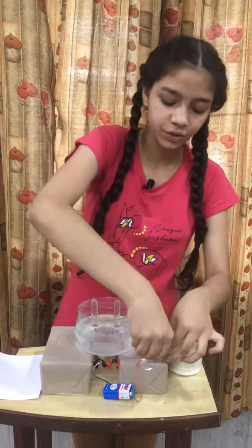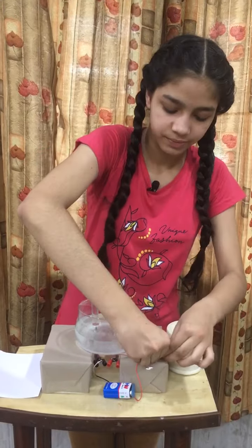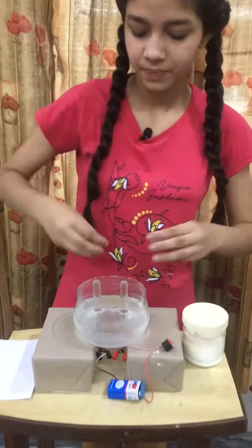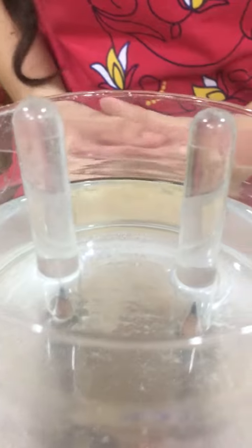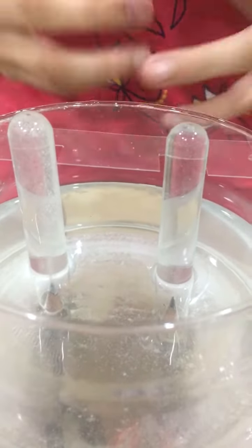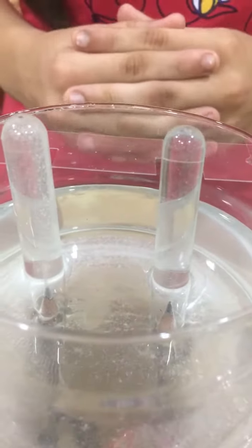Now everything is ready. We just have to turn on the switch. Now let's see what will happen. As you can see here, in both the test tubes, bubbles are forming.